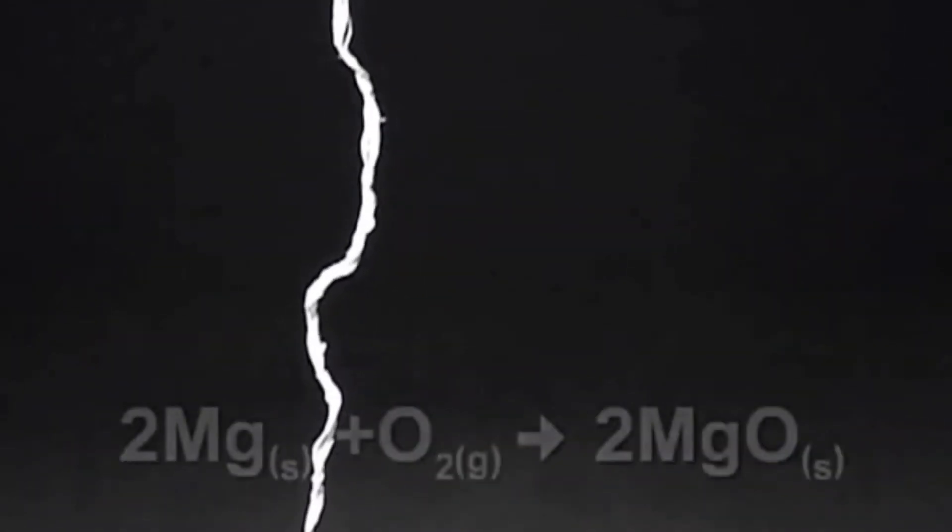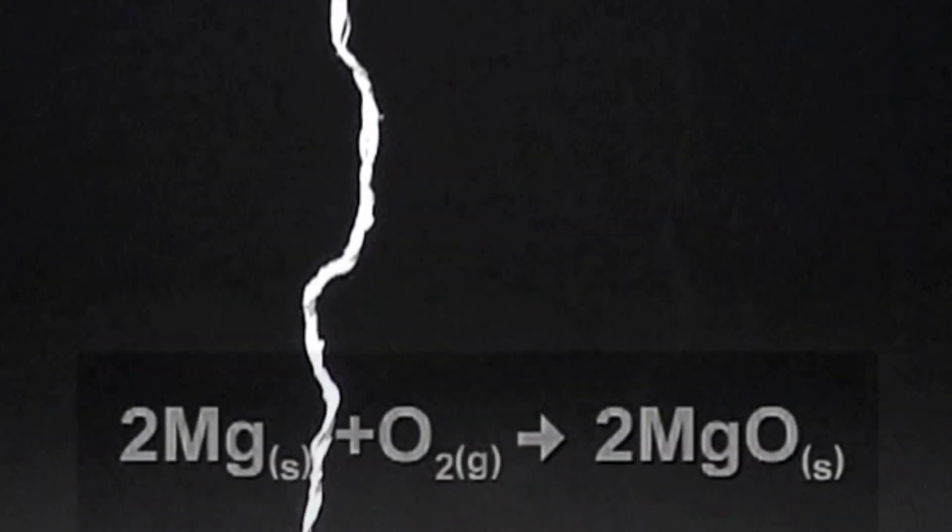The combustion reaction is a very rapid reaction.